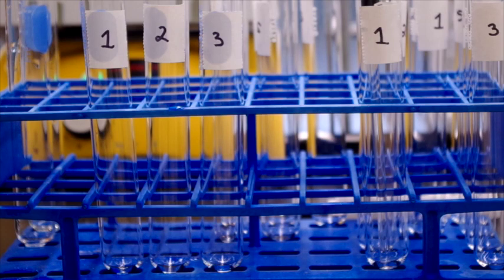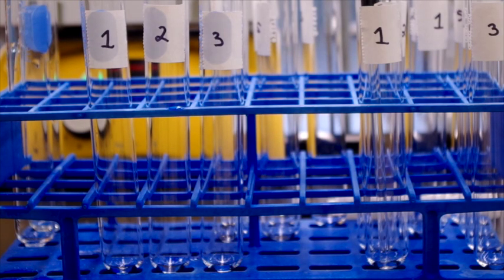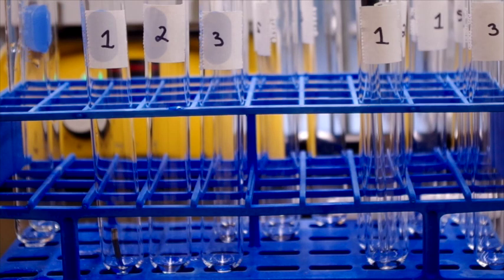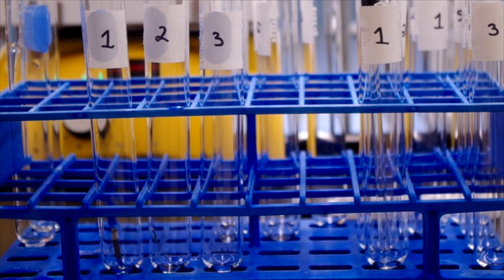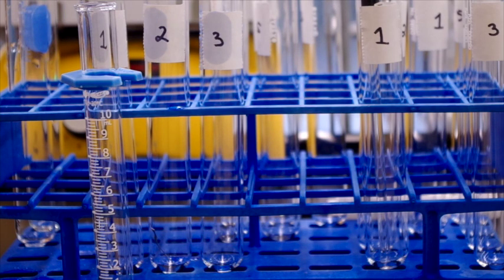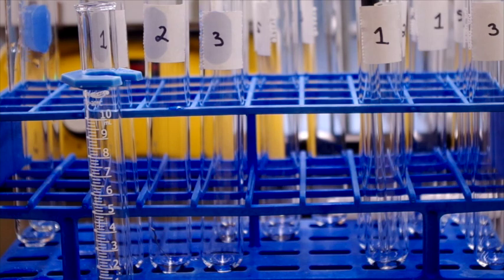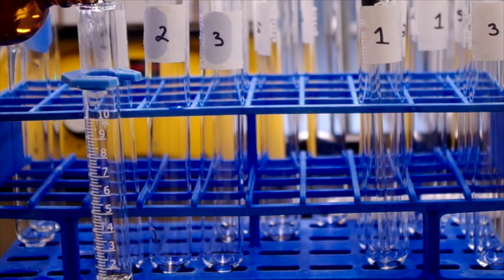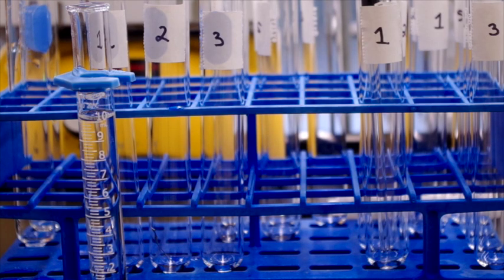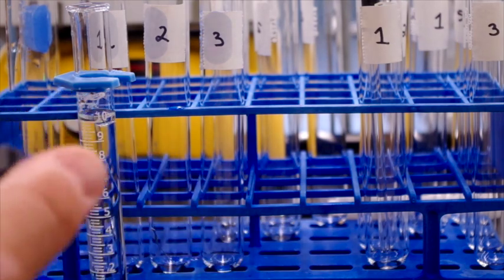Part A2 of this lab is testing the effect of changing reactant concentration on the rate of the reaction. The reaction in question here will be the reaction of magnesium ribbon with hydrochloric acid. We have three pieces of magnesium ribbon that we add to each of the test tubes. The procedure instructs us to start by adding 10 milliliters of 1 molar hydrochloric acid to test tube one, then beginning a stopwatch to record the time immediately.